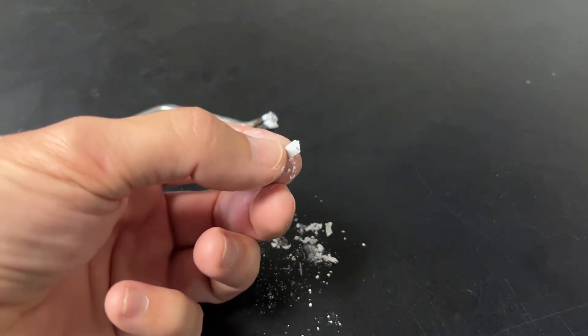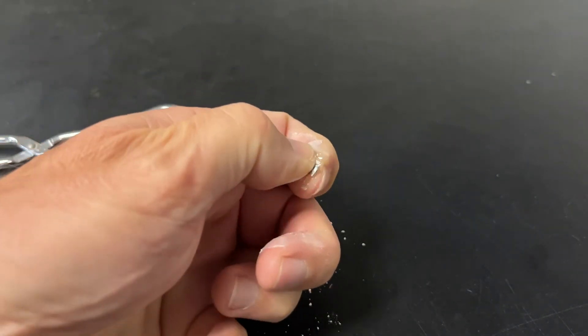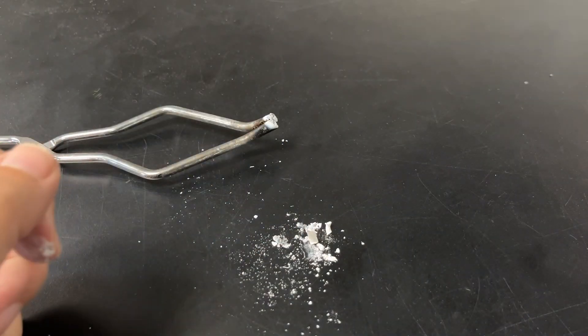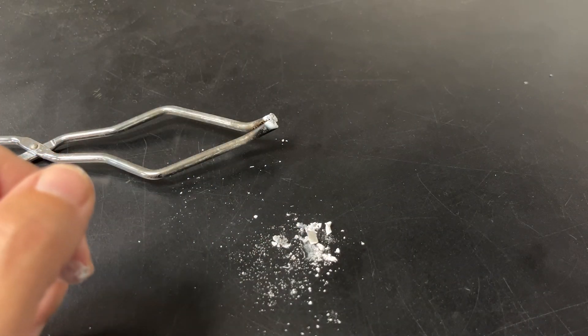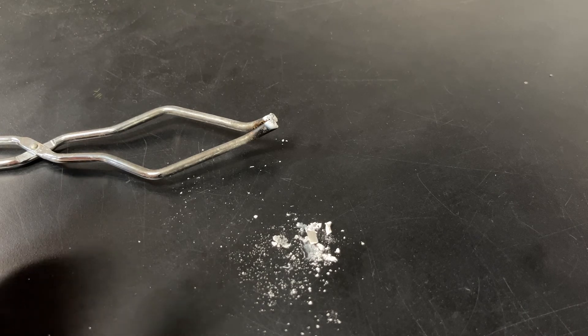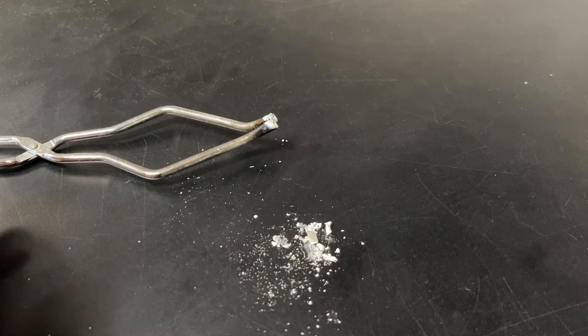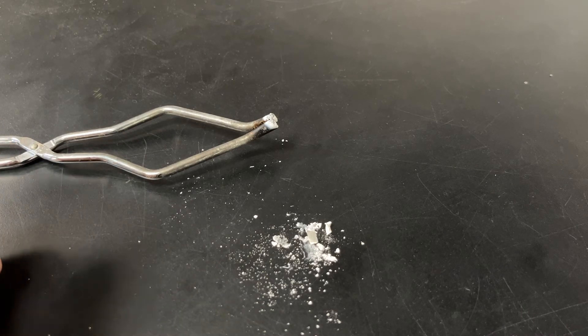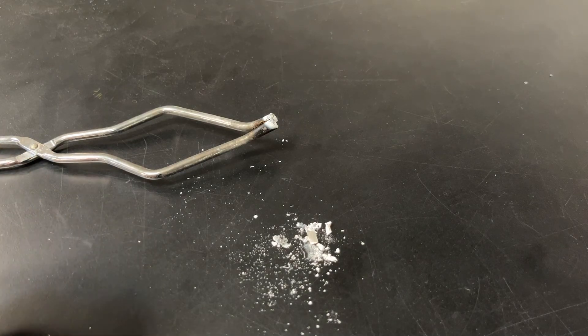I rusted that metal within five seconds. And this reaction requires more than just a lighter or a flame. You need to have a torch to do this. It needs enough energy to get started. And that's what happens when you burn magnesium.